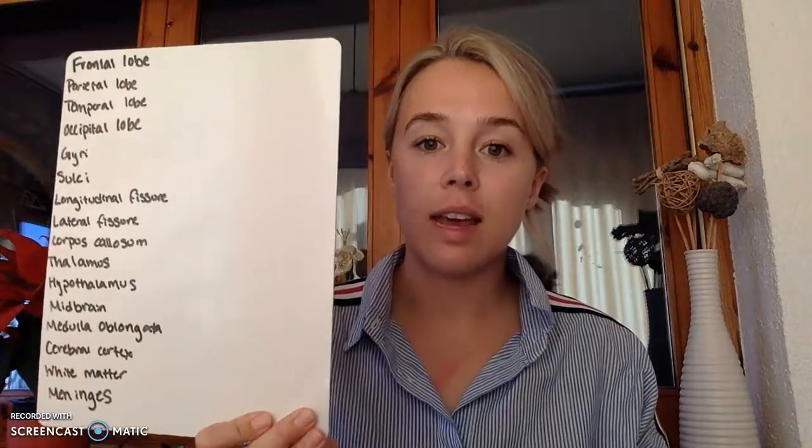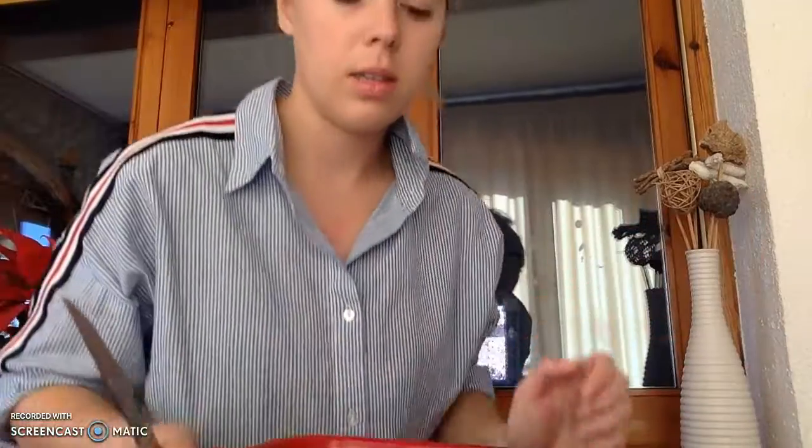It is a Thursday. And today I'm going to show you a dissected sheep brain. Unfortunately, it kind of smells. I'm going to be holding my breath. So this is my list of things that I must identify just so I keep on track. Okay, now the best way to do this.